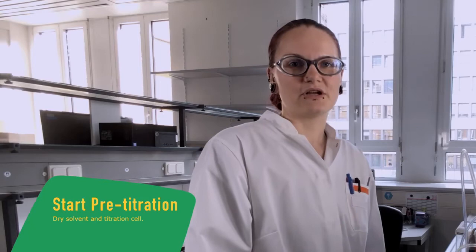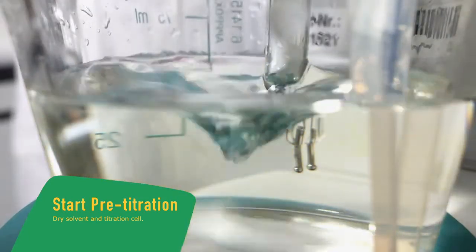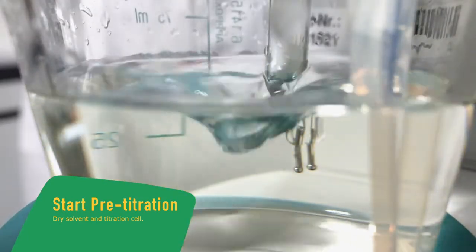To dry the solvent and the titration cell, we now start the pre-titration.